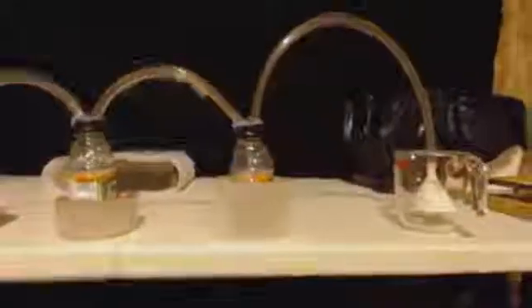to the funnel. That funnel, when you're ready to actually use this apparatus, you can put a stick or a scissors or something across that cup there, right? Tape it to the cup so it doesn't move. And then when you put some water in there, you want to put the funnel right below the surface of the water. And then you can tape it to that pair of scissors or a stick or whatever and have it nice and level and in the water, and it won't move that way.